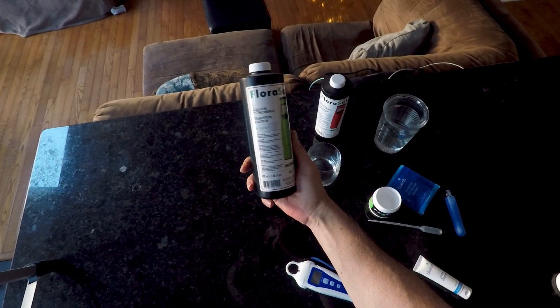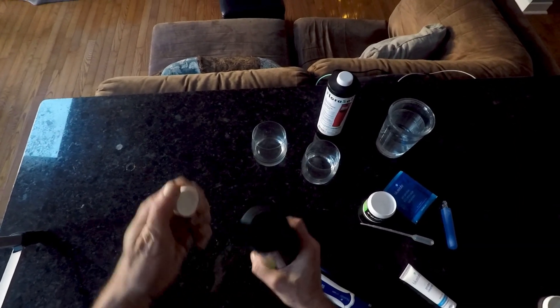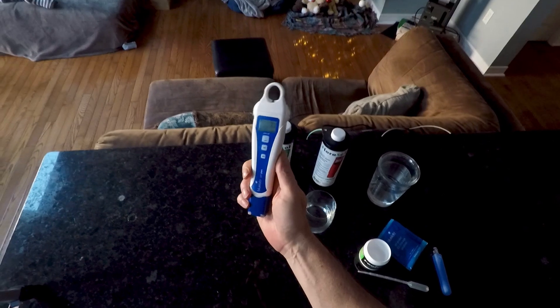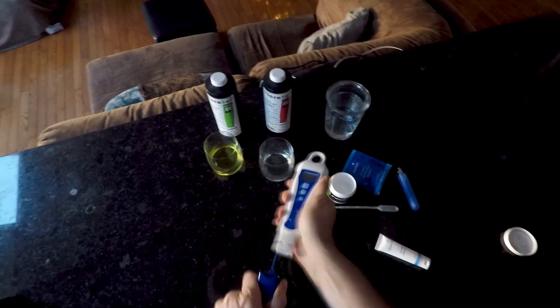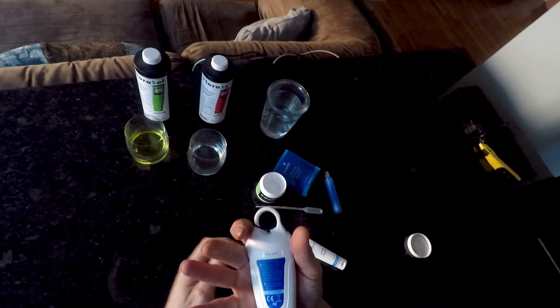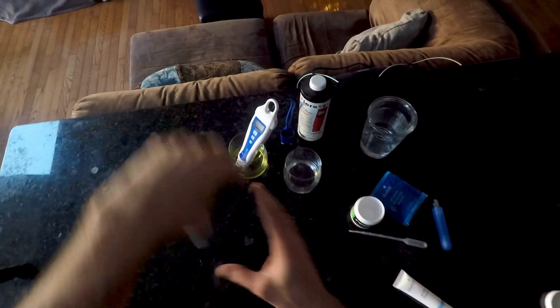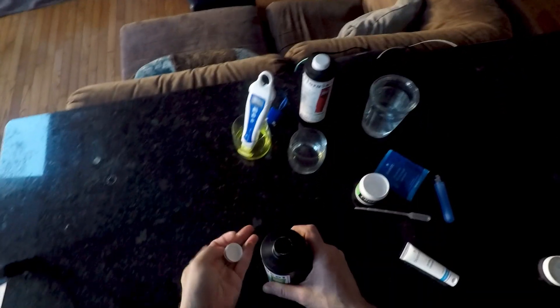So we want our 7 pH solution right here. Ironically it's sitting at 7 right now. Okay, we stick that in there and then we hold the Cal button until it displays Cal. It might need a little more in there. There we go.